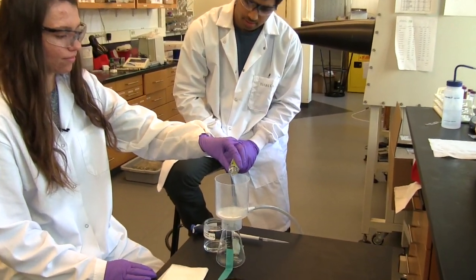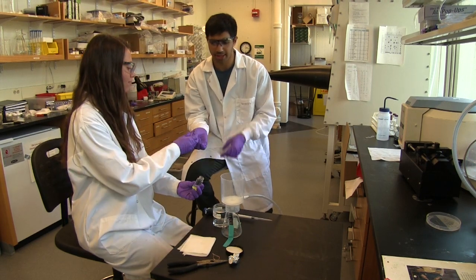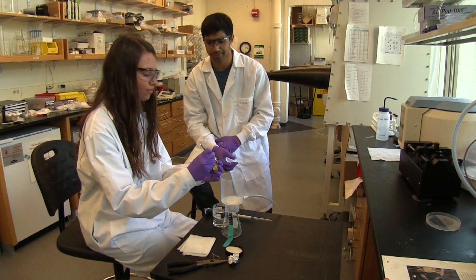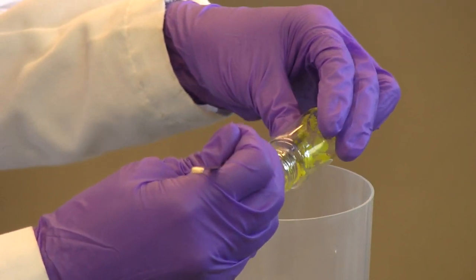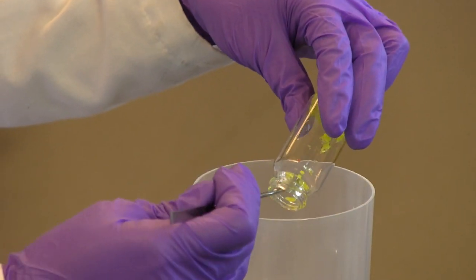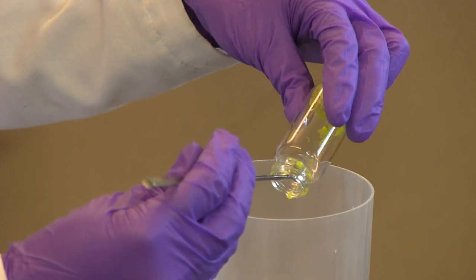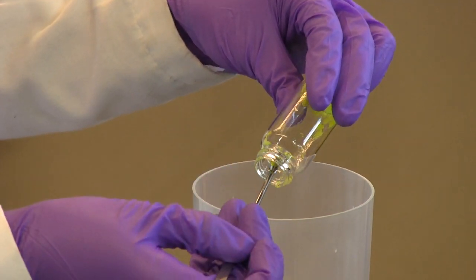So, not all of the solid got into the filter, so you can scrape some of that out directly in. Should I be worried about breaking any of the crystals? No, it's okay. They're pretty robust.